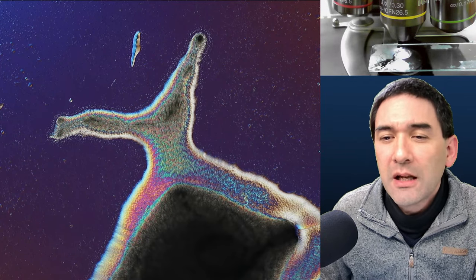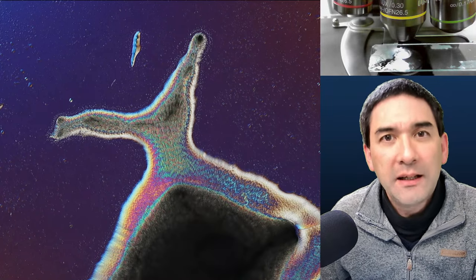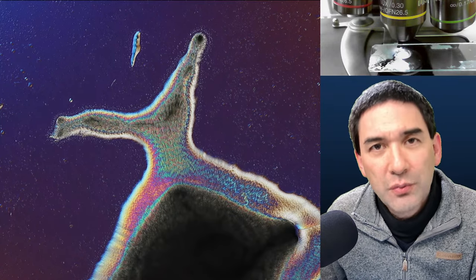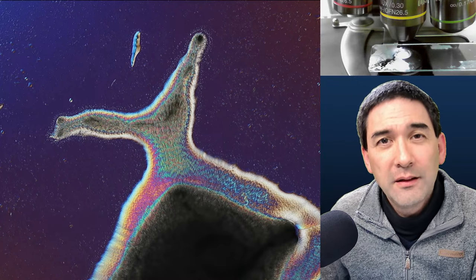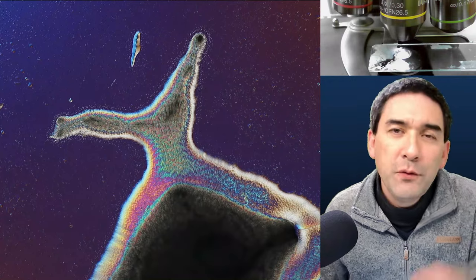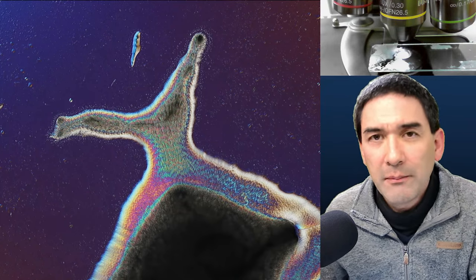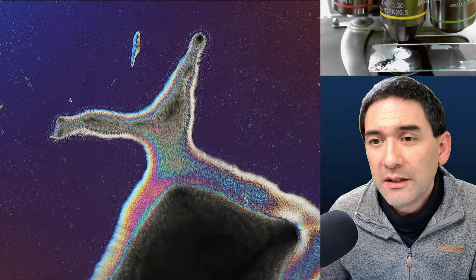There's a question about adding light from the top to see through the thick areas. It is possible to add a light from the top, but it won't look nice because we need polarized light from the bottom for the colors. If you shine light on top, it's going to look very white with no colors. You can try it with a strong flashlight, but it will be pretty disappointing.